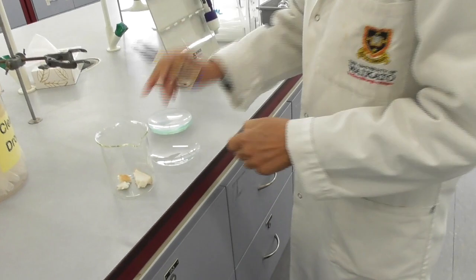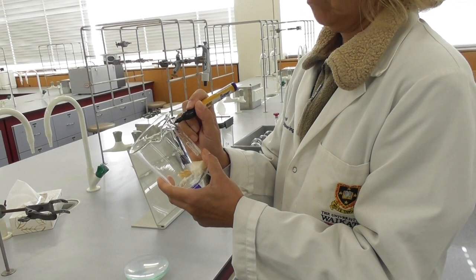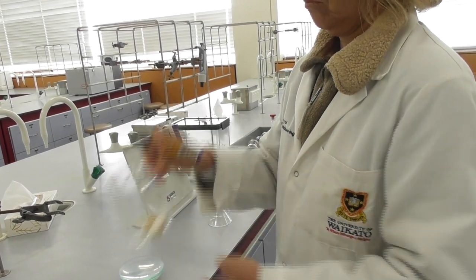Next step is I label my beaker with my initials so that I can tell it apart from the others later on in the fume hood.